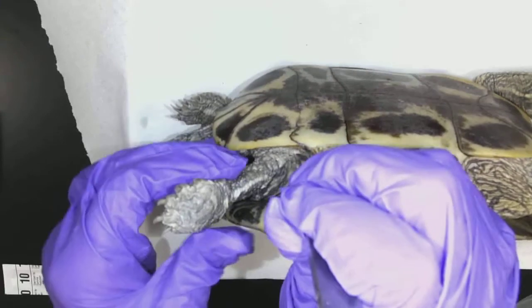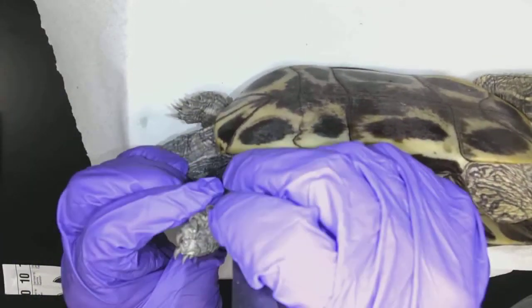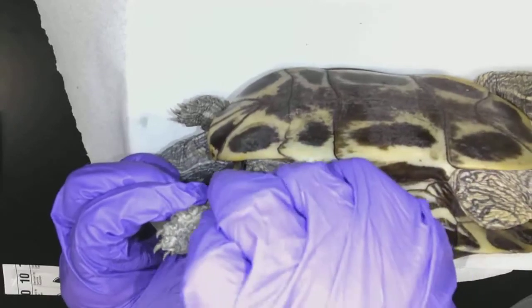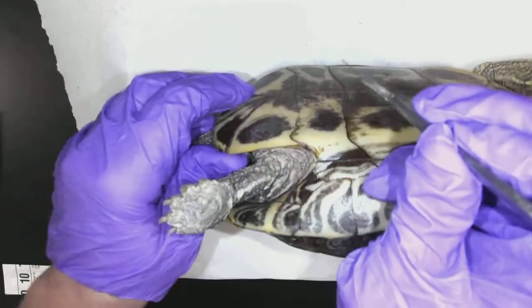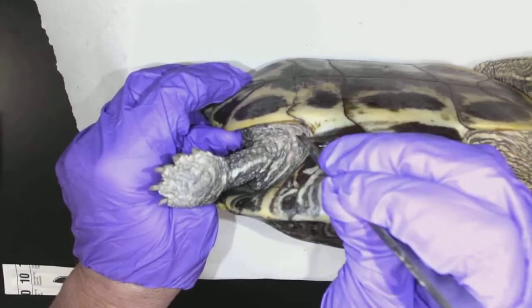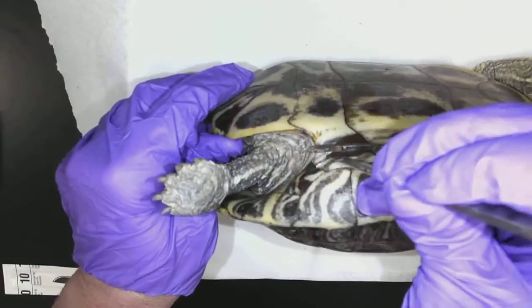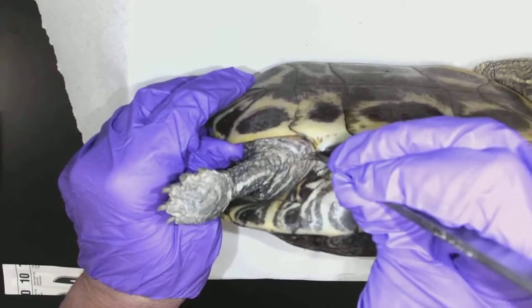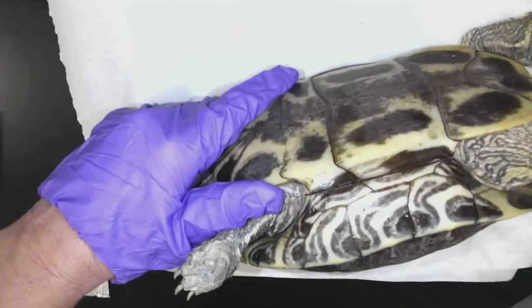Now, if it's really strongly preserved, I can rinse it off. The smell of the preservatives can really bother my eyes. If I rinse it off though, I'm now rinsing off the preserving power. And depending on how long I need this animal to not rot, not really get moldy, the less I want to wash it off. So if I need it to last for a few months, don't wash it off.